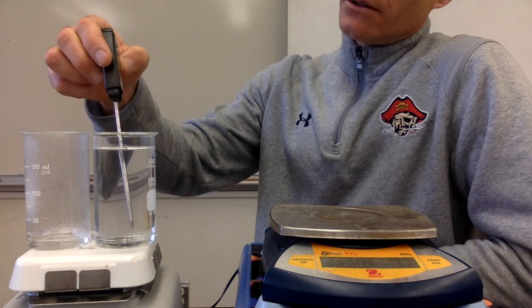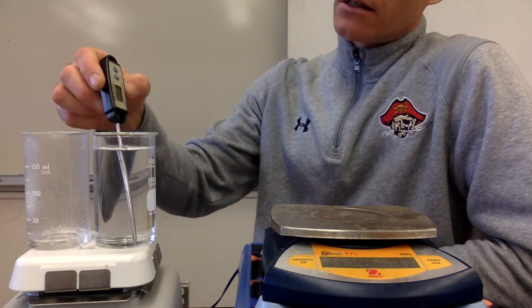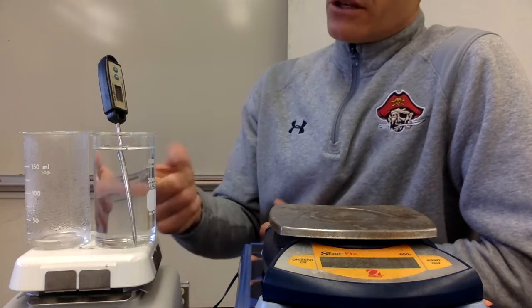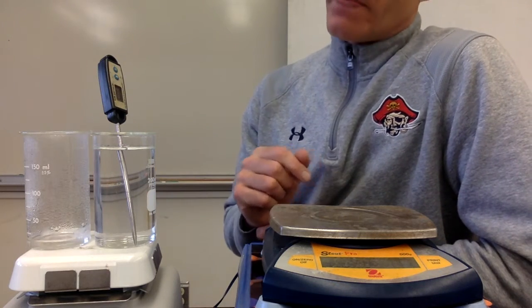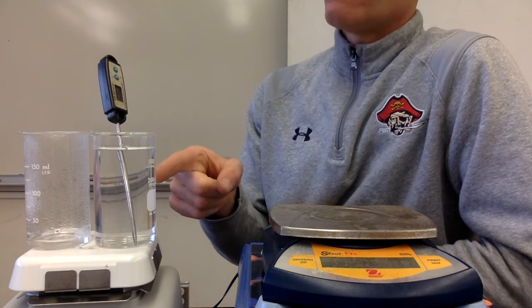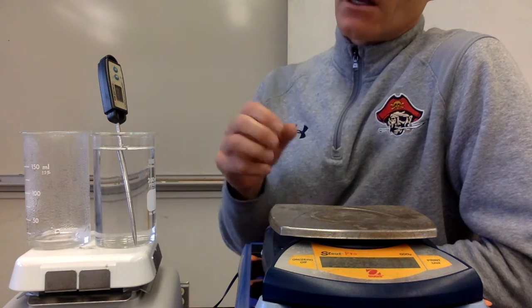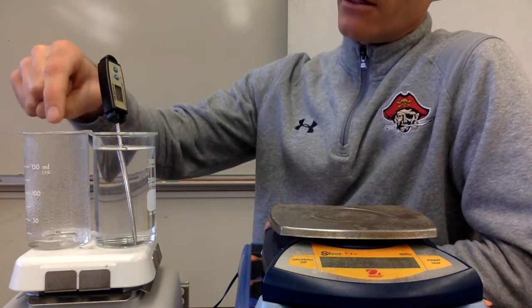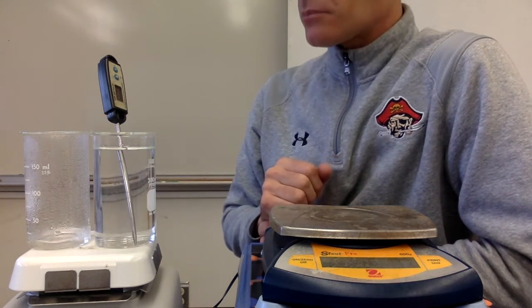This water is up to 18.9 degrees Celsius. We know the specific heat of water. It's 4.18 joules per gram degree Celsius. And so with the equation Q equals delta T times mass times specific heat, we can figure out how much heat was absorbed by this water, and it'll be equal to the amount absorbed by this water, and that's how much heat it took to turn this one to a vapor.